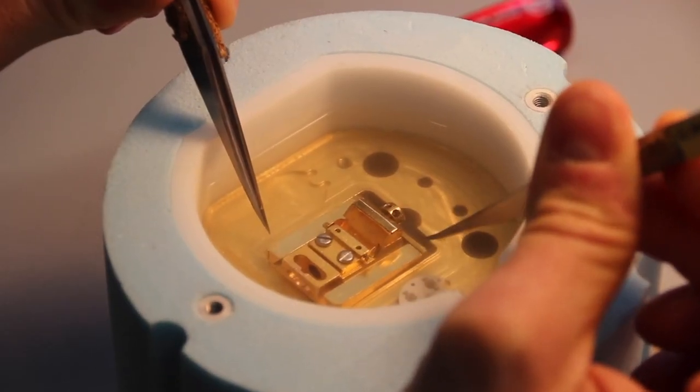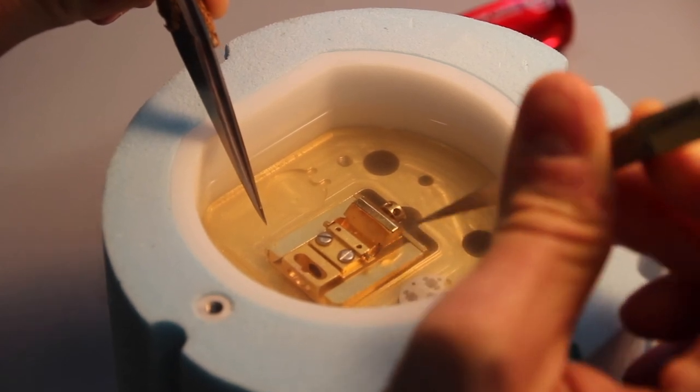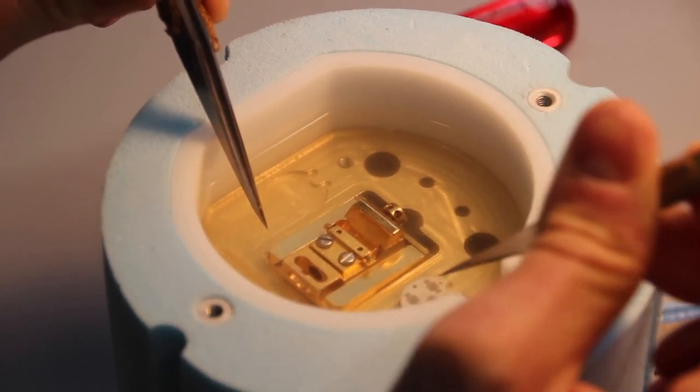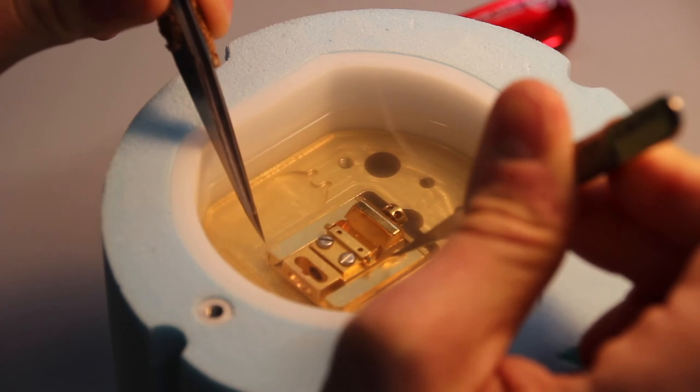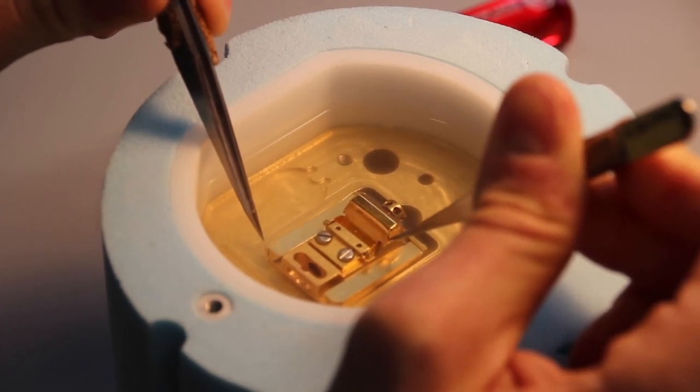Once you have your transfer box over here, you can rotate the shuttle. Make sure you have a grid box ready to accept the grids. Open the shield.